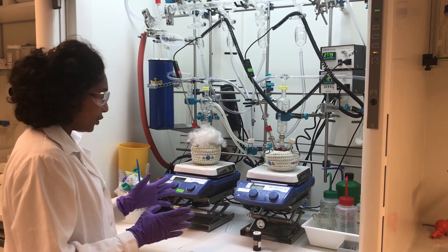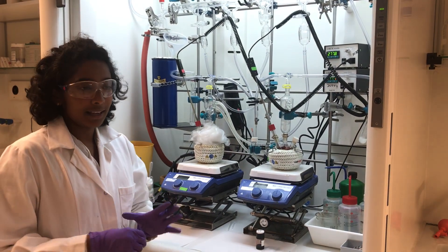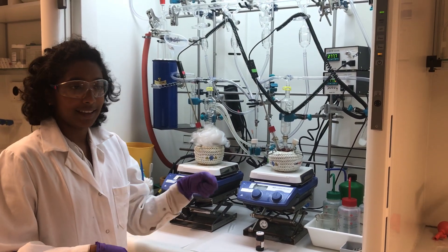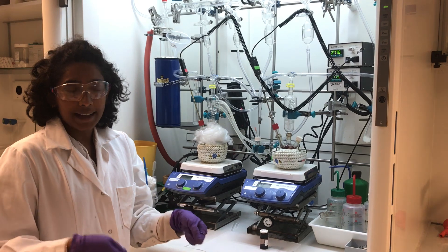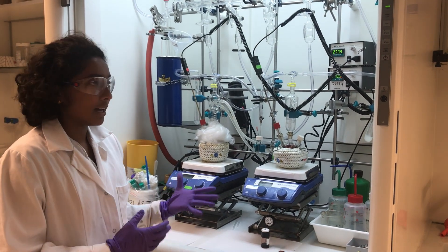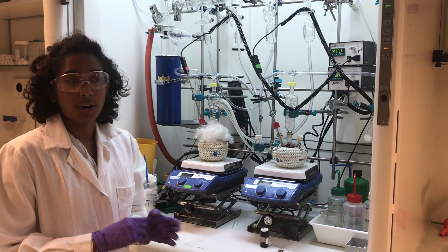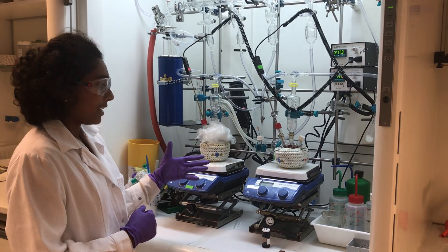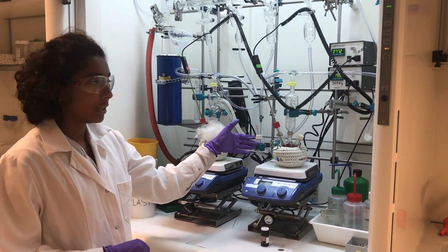Usually in cooking, what we do is we add oil to a pan and we start heating up the oil.